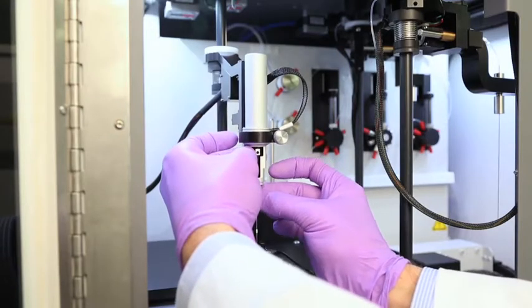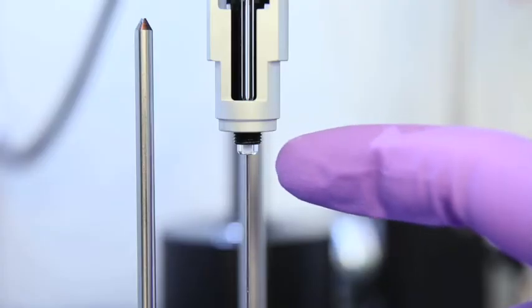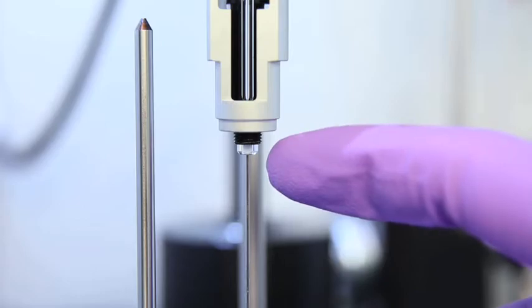If aligned properly, the installed syringe glass should leave about 2 mm of glass exposed.